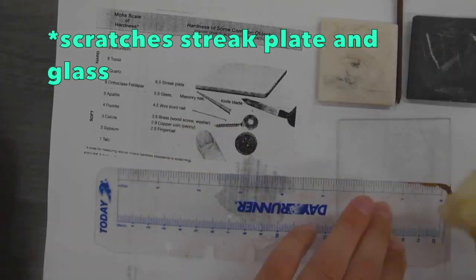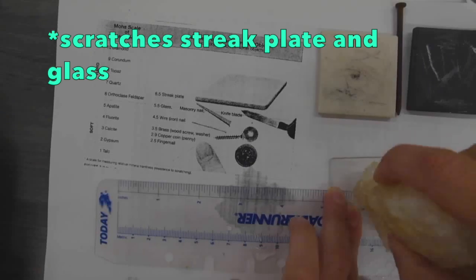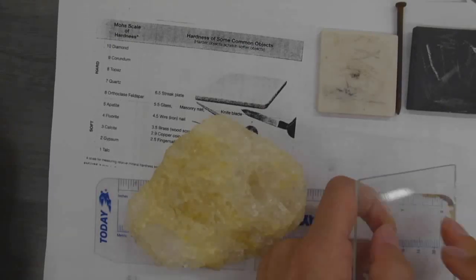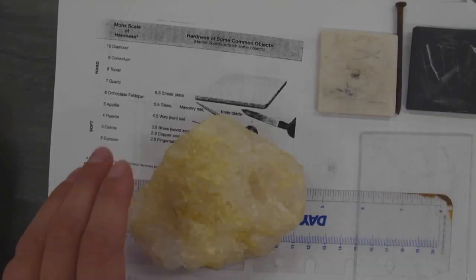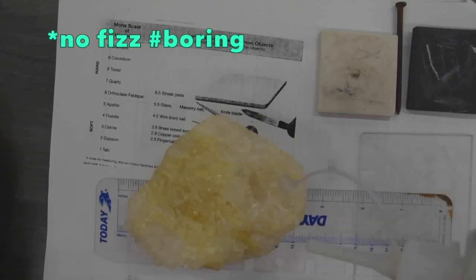And so I'm going to take the glass and get a good little rub-a-dub. And bada bing. What do you know? Focus that camera. Yeah, it really scratches that glass right there. So yeah. Woo. And I'm putting some acid on it. Some good old HCl, and it's not fizzing.